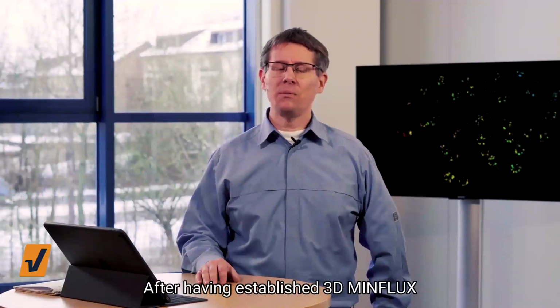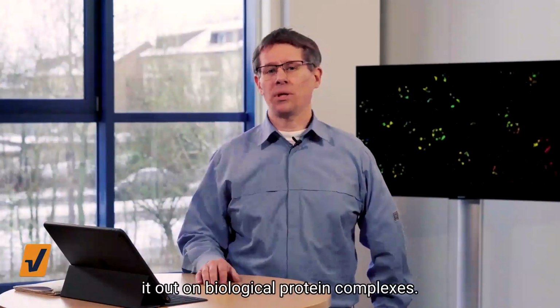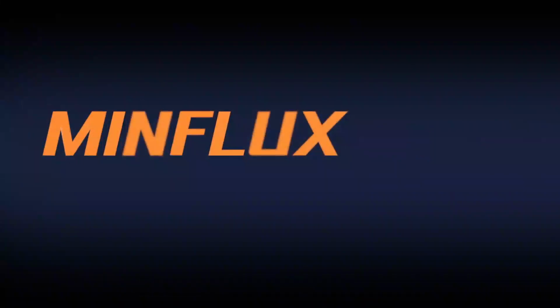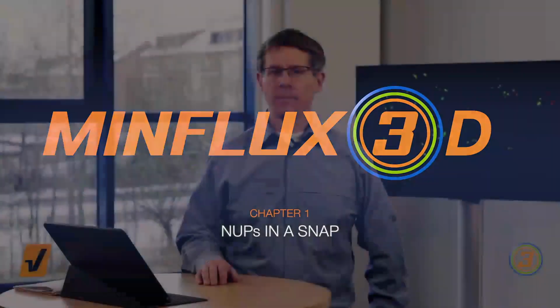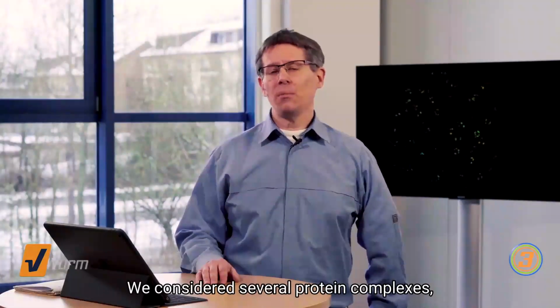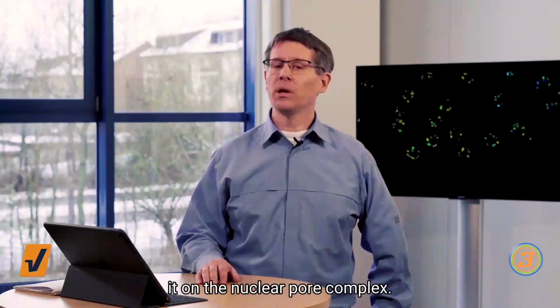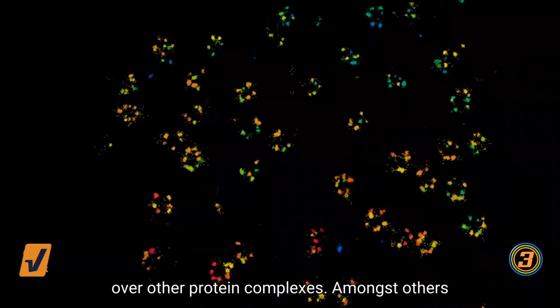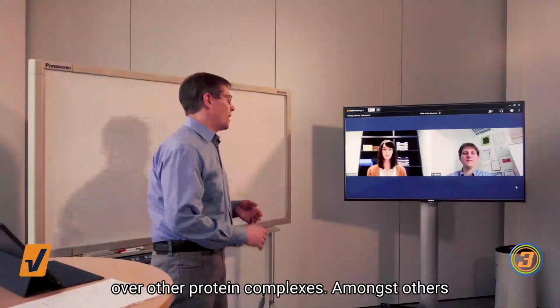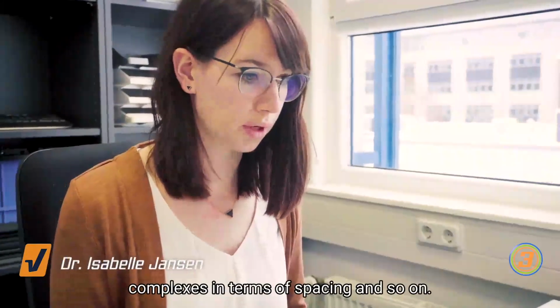After having established 3D MINFLUX on technical samples, we decided to try it out on biological protein complexes. We considered several protein complexes, but ultimately came out with a solution to try it on the nuclear pore complex. The nuclear pore complex has a set of advantages over other protein complexes. Amongst others, it is one of the best characterized protein complexes in terms of spacing and so on.